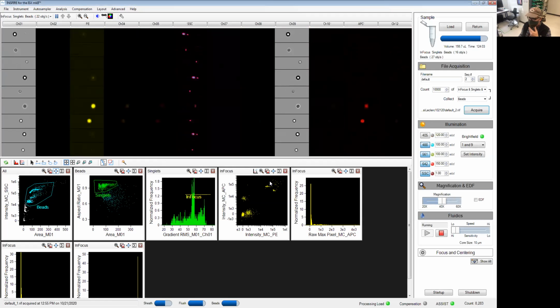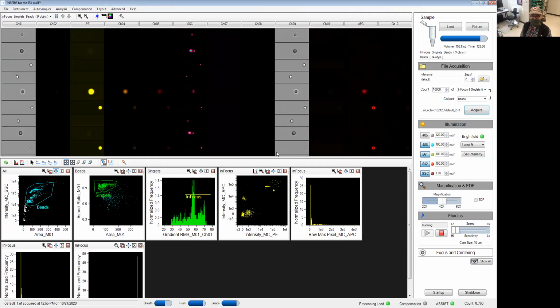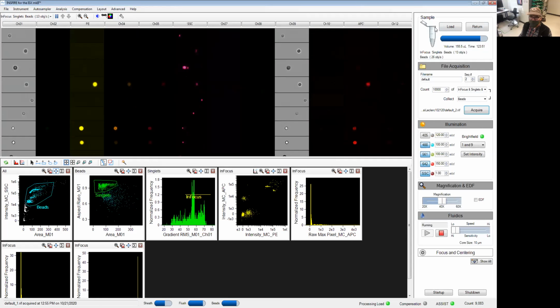We'd be done with the acquisition, so let's skip to the next sample. Right now, what I want to do is run my compensation controls. Before I do that, I'm just going to explain what happens when you remove your sample from the instrument.